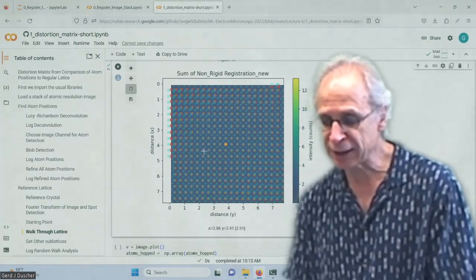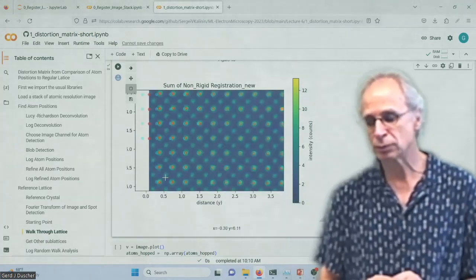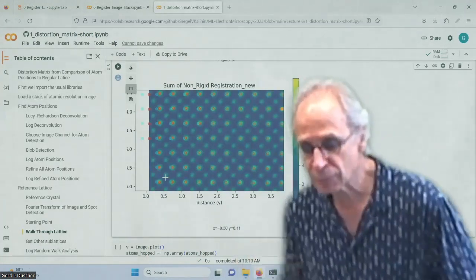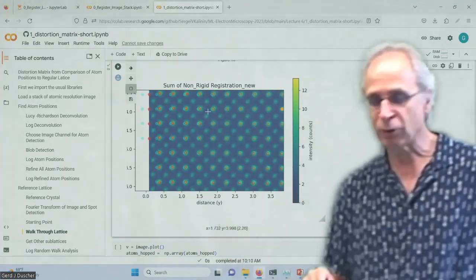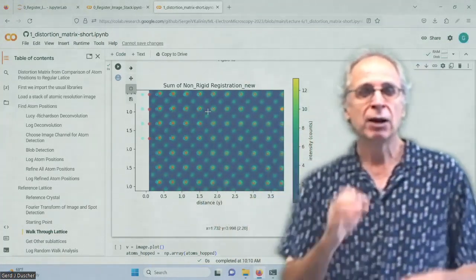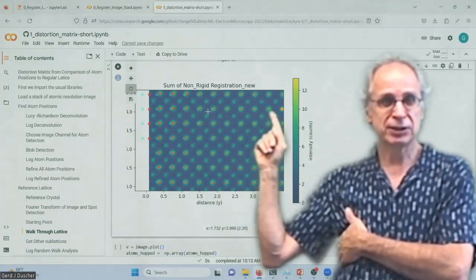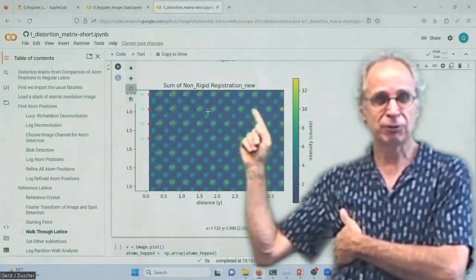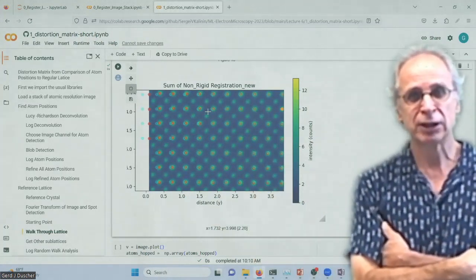I jump to the next atom. Now, blue was maybe not the best one to determine. So I start up here and then jump over here. But I also know where the ideal position should be, right? Because this is the nearest one. So I jump over here, find the next nearest neighbor. And I do that with a breadth first search.